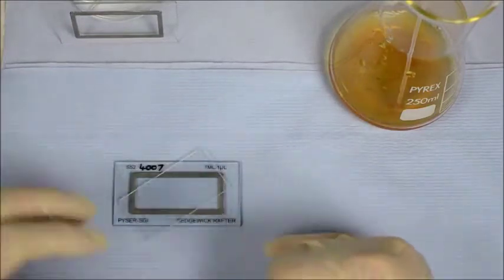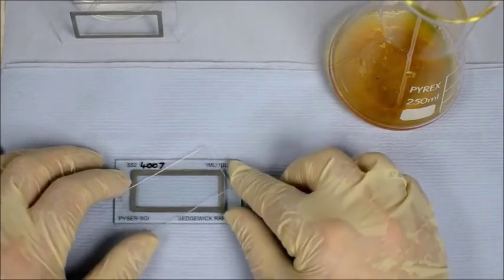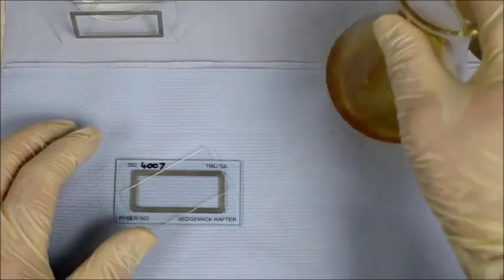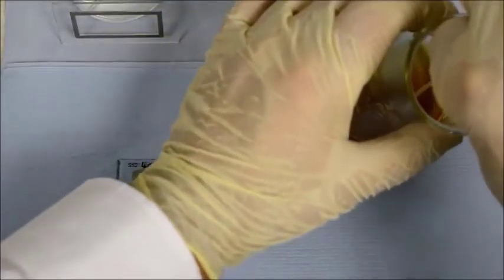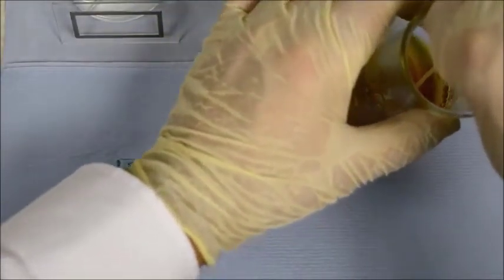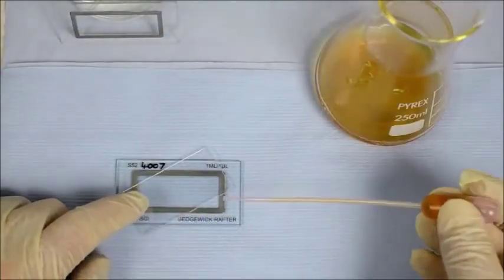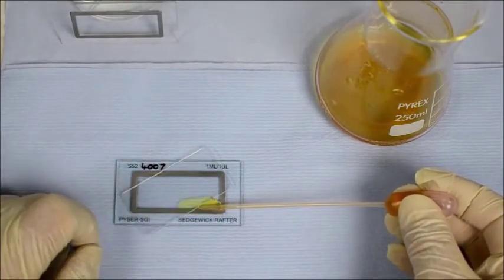So this is one side to fill from and one side to allow the air bubbles to escape during the filling procedure. And this is our sample. So it's well distributed, well mixed, and we measure the sample. We need 1 milliliter at least in a wide neck pipette. Okay, and we fill from one edge here, keeping the pipette nice and flat, and just fill through.